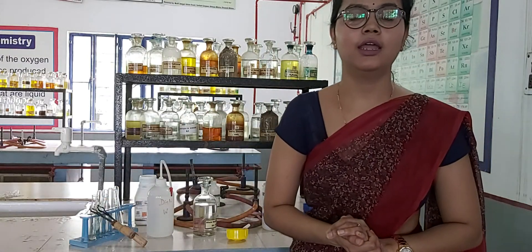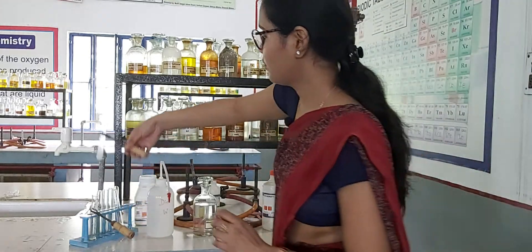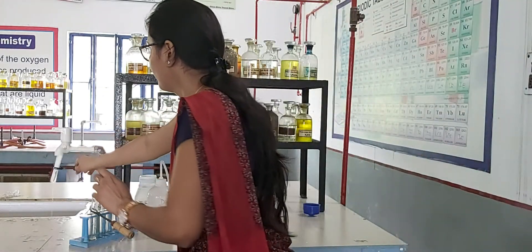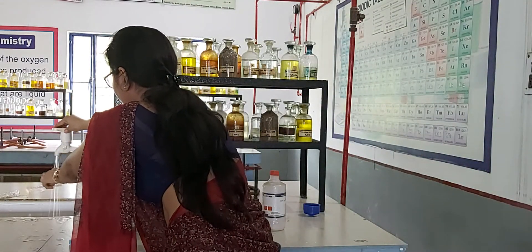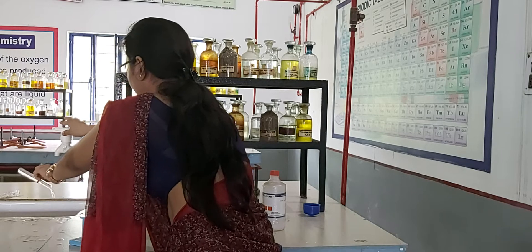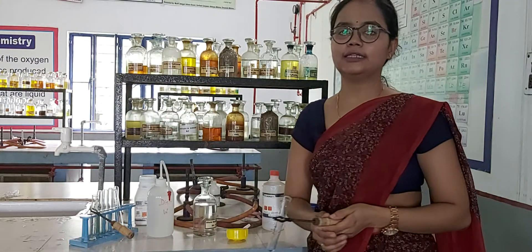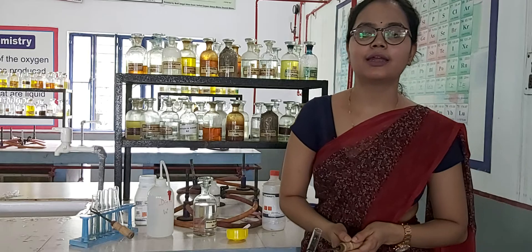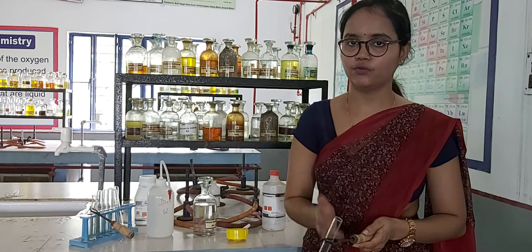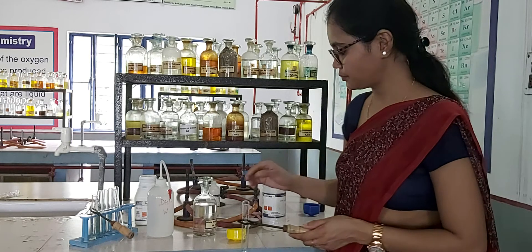This brown precipitate shows the presence of ammonium ion, so we have identified our basic radical. Now we have to detect the acidic radical. As I mentioned, acidic radicals are classified into three groups, and we will start the detection from the first group.